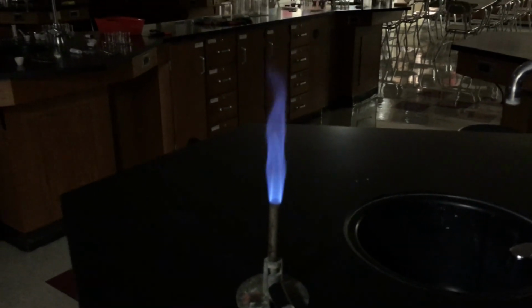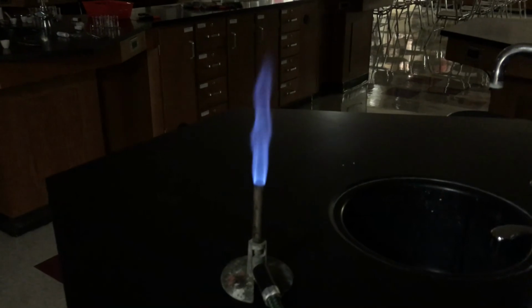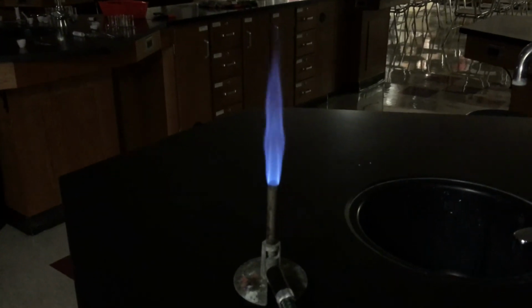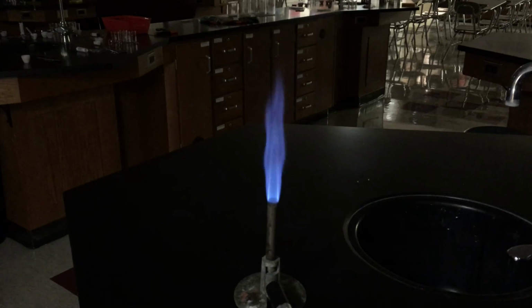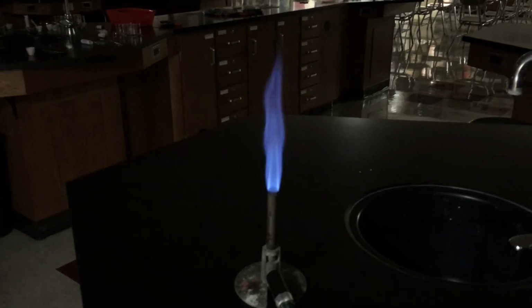We're going to use metals because they hold on to their electrons a little more loosely, so we can get some better jumps out of them. And we're going to specifically use metal cations because we can get them dissolved in solution a little bit easier, and it's easier to test them in the flame that way. Okay, so we're going to look at a number of different metal cations and see what kind of colors they release when we put them in the flame.